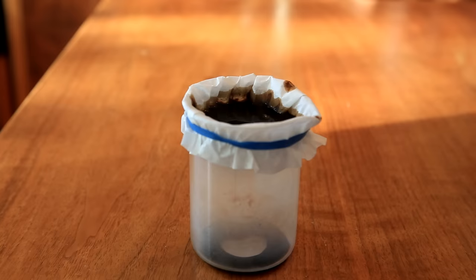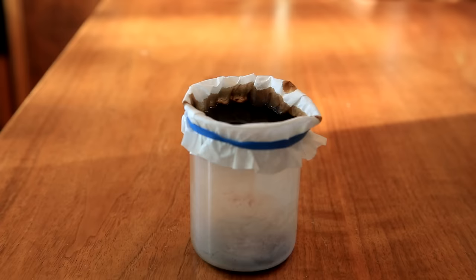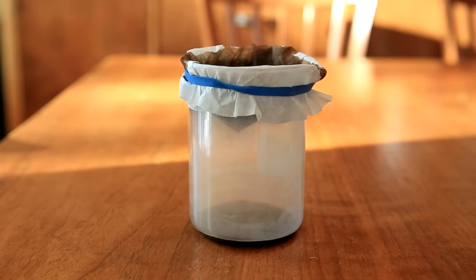The one issue with using gravity filtration for this part is that it's pretty slow, and as it goes on the solution will cool down. This is a problem because we want to keep it as hot as possible so it can dissolve as much of the caffeine as possible. To limit some of the heat loss, a watch glass can be placed on top.